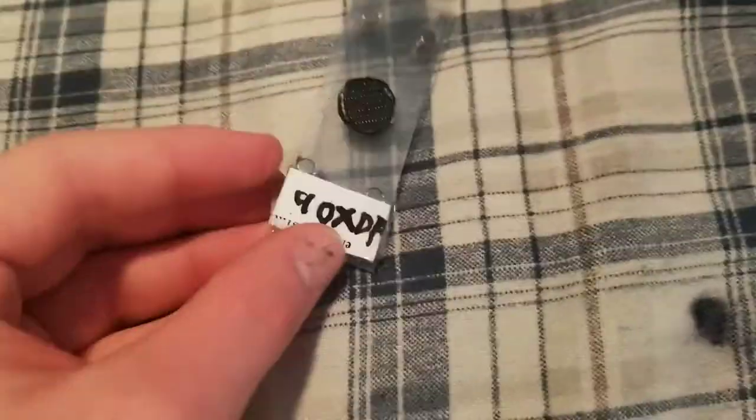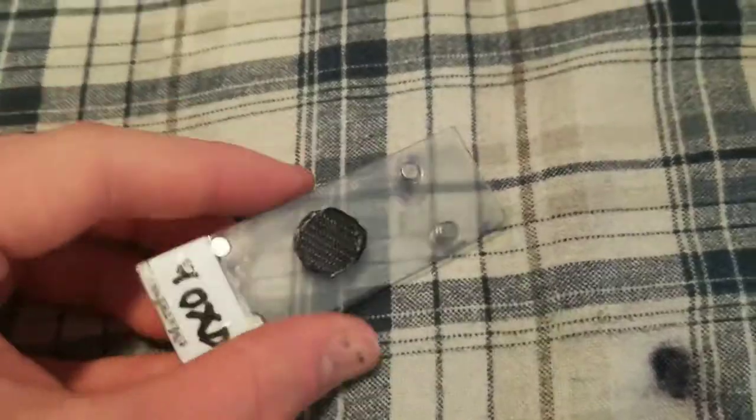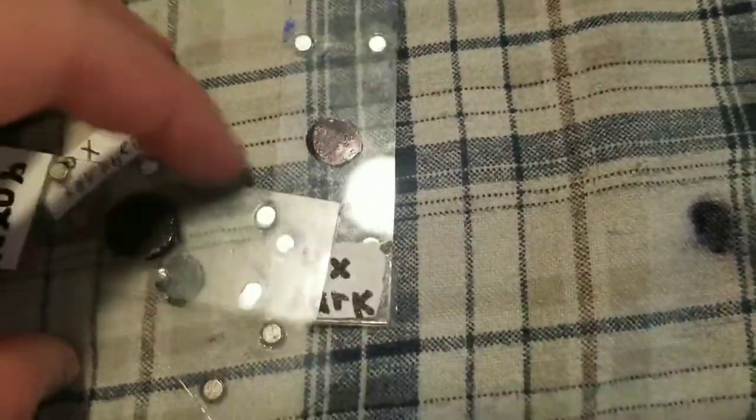Disaster experiments here. So I did mention making dark field filters for my microscope out of glass, and I did make a lot of prototypes.